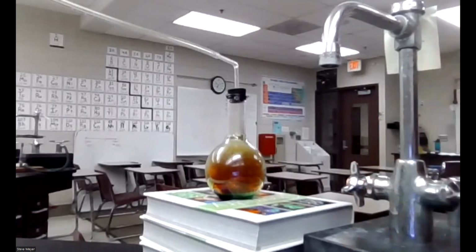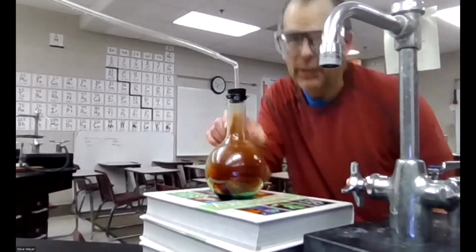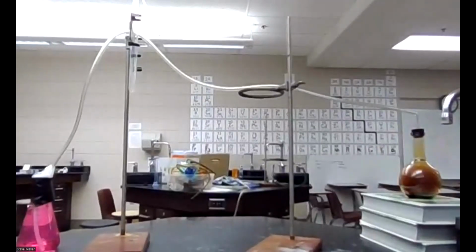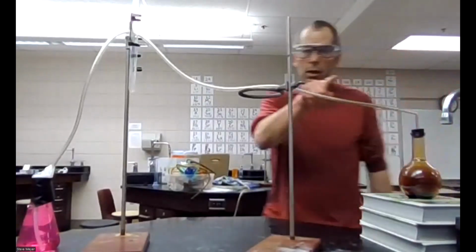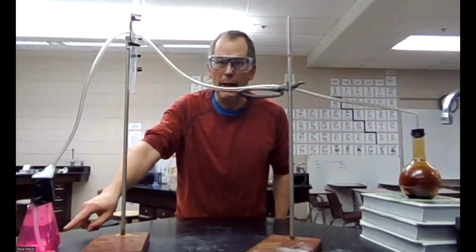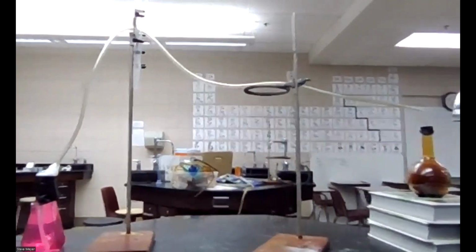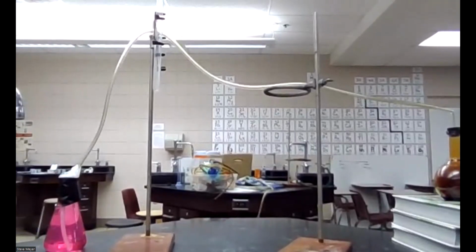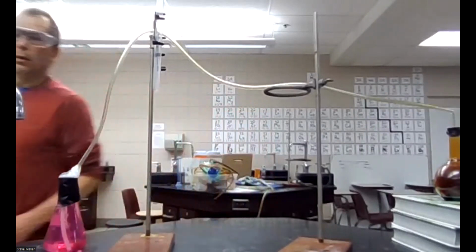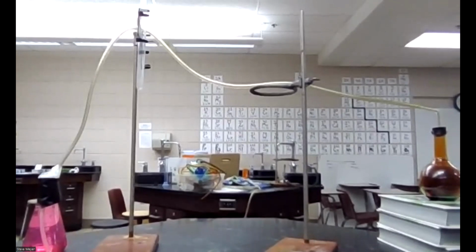So I'm just going to slide this back. We can kind of see this going kind of greenish on the bottom. It's spitting out this gas, and this gas is going through this tube, and it's going up through this tube here. And I think you can see it bubbling down into this pink right here. Something's going to happen there, but I think we're going to take a little bit of a break watching that there, and then go to a screen share and do a little bit of problem solving, and then we'll come back and see what's happening with that.